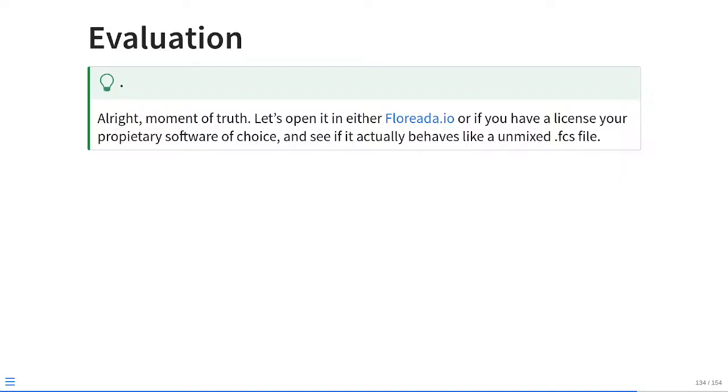So at that point, probably the best way of doing this quickly and reliably would be, if you have commercial software, open up your commercial software. If not, go to Floreada.io or online, open it up just to make sure, are all the parameters showing correctly? Is everything visualized in a normal way, or is it all a teeny tiny dot way off in the distance? All those kind of quirks that might potentially happen.